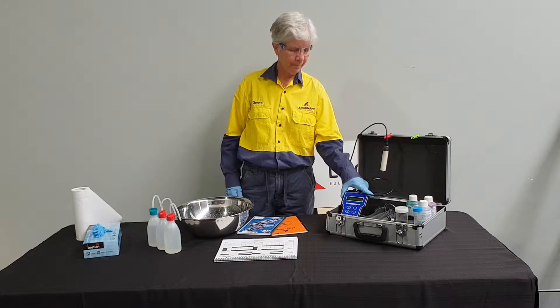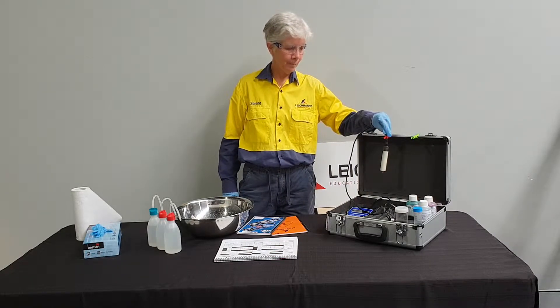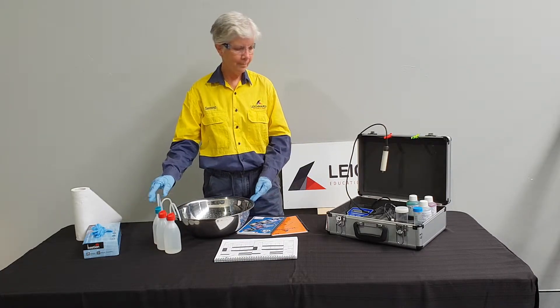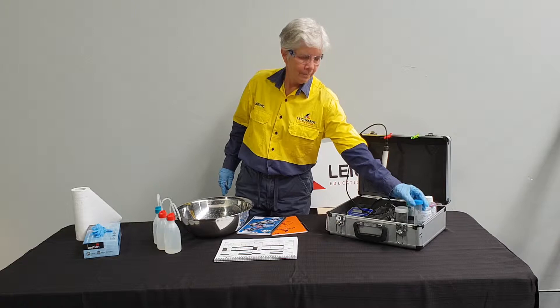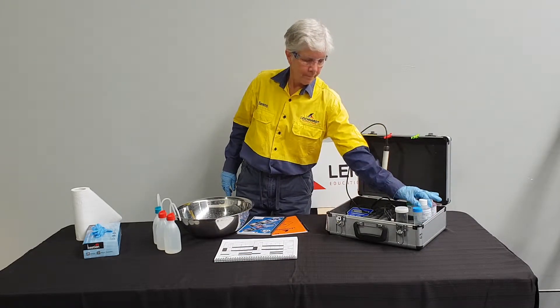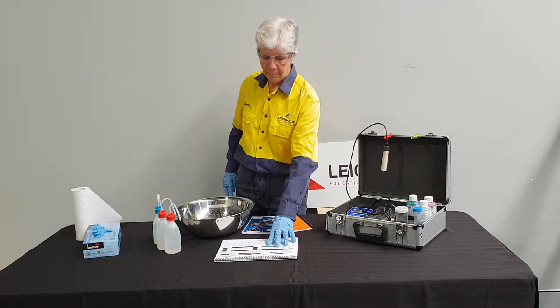We will require a WP81 meter with a temperature and conductivity probe, a bowl and deionized water for triple rinsing of probes, a falcon tube, the appropriate lab-prepared calibration standard and an operating manual, safety data sheets, and a calibration record sheet.